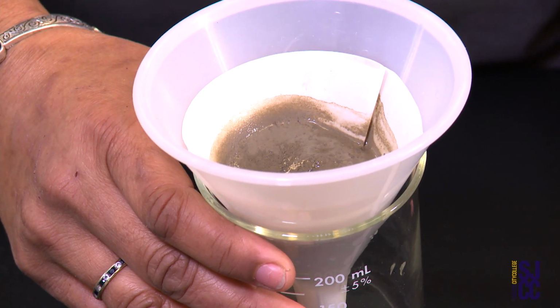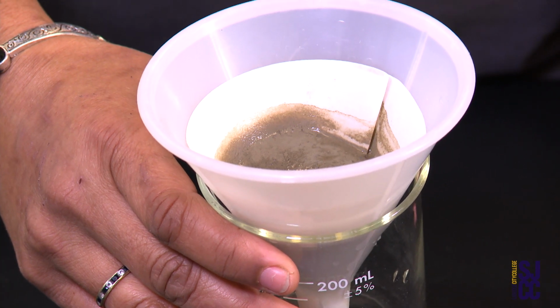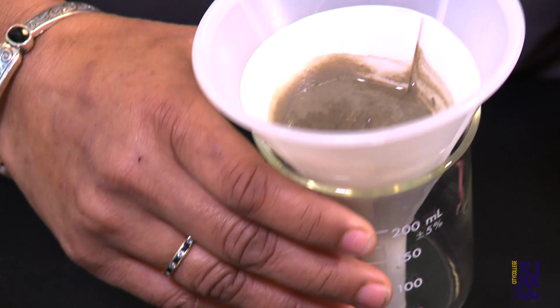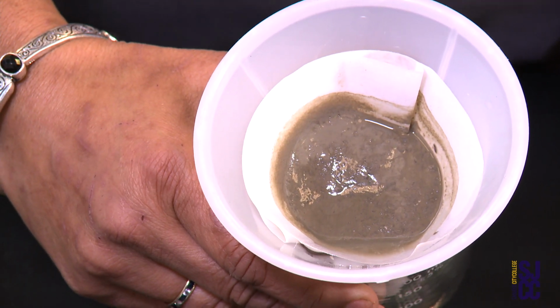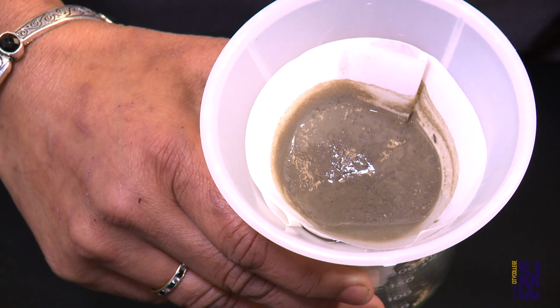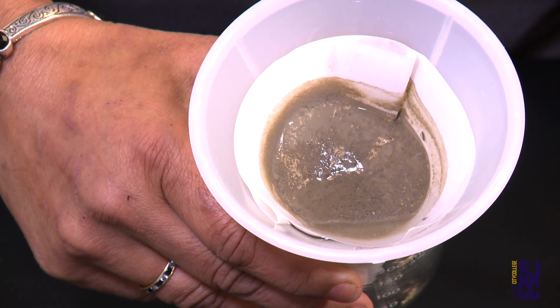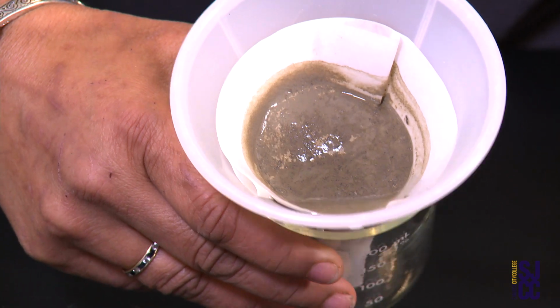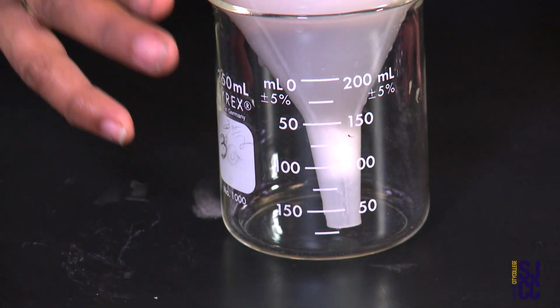And with that, clay is also the opposite end of the sand by retaining a huge amount of water. So we're going to, again, look at how much water is retained in the clay by pouring it out into our graduated cylinder and measuring how much water was coming out and how much water was retained.